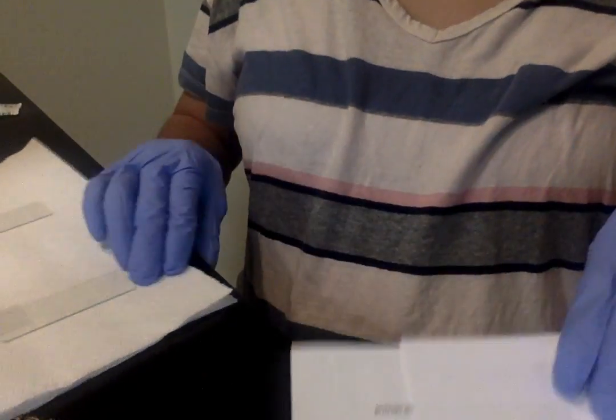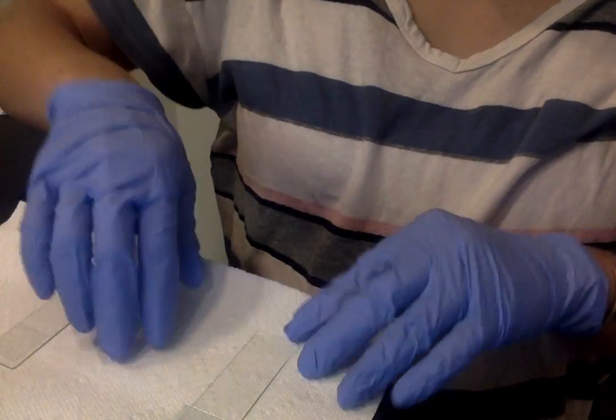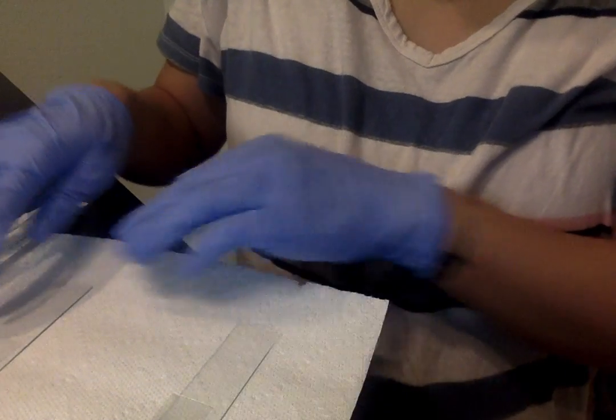The third part of the experiment, which I will be demonstrating, is exercise three. This is the wet mount slides. So everything is sterile — I'm using my gloves. I have my two slides here, my sterile swabs, and the coverslips for both. And I have my distilled water here with the long pipette.